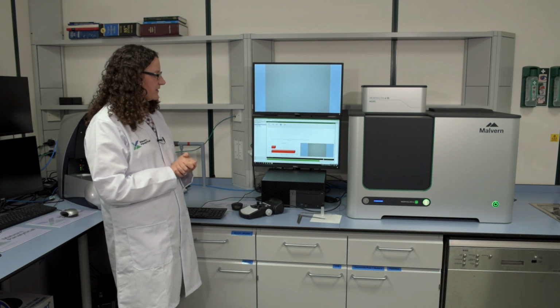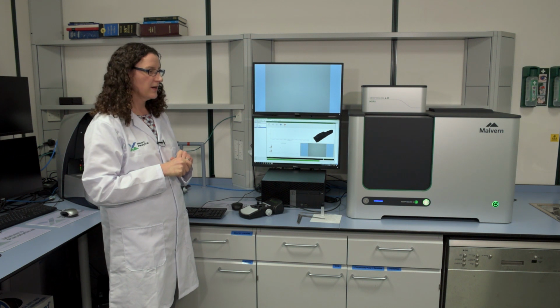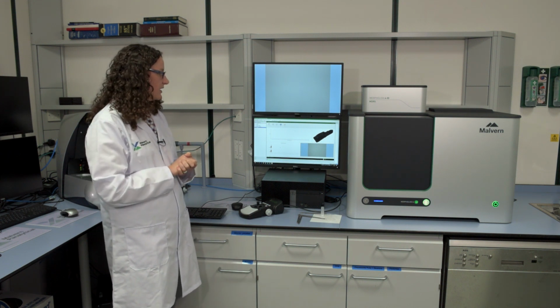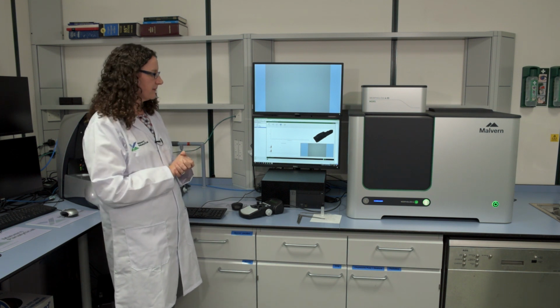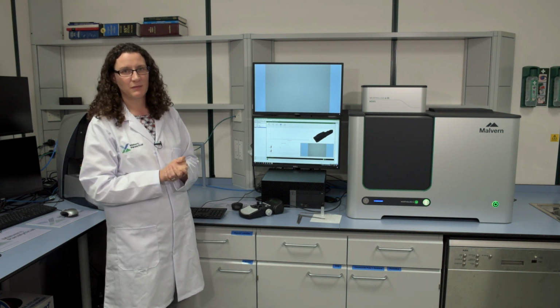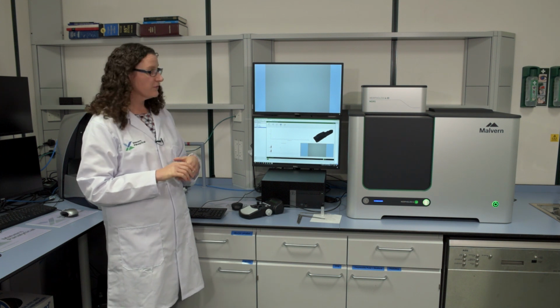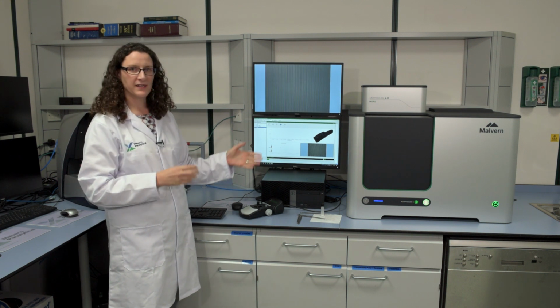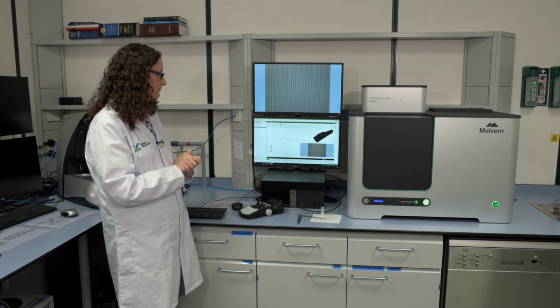The system has now finished the morphology part of the analysis, and it needs to go back and do a few more reference items to check before it continues with the ID part of the analysis. Some of those are a repeat of what we've done previously. Now, a typical morphology measurement takes somewhere between 10 minutes and maybe half an hour, depends on your sample and how many particles you want to measure. But for the purpose of this demo, I've kept it quite short. And that's why it needs to go and repeat some of these checks, because if it's been a while, it wants to check everything is in order.